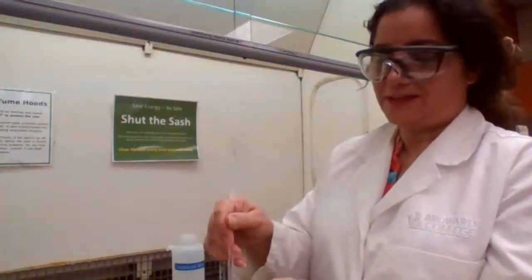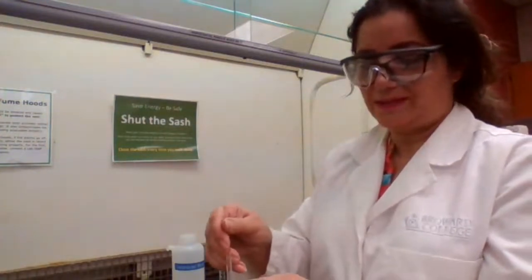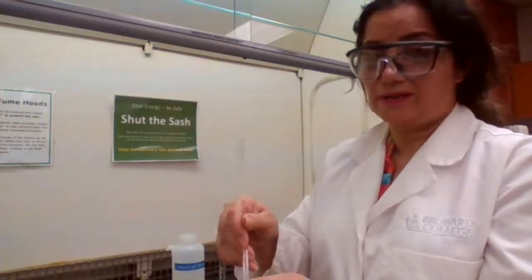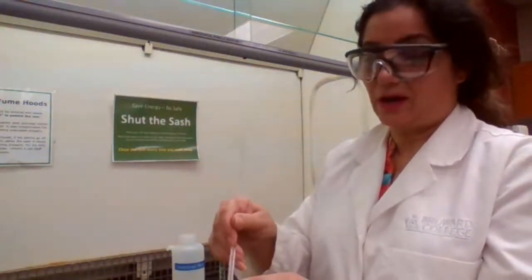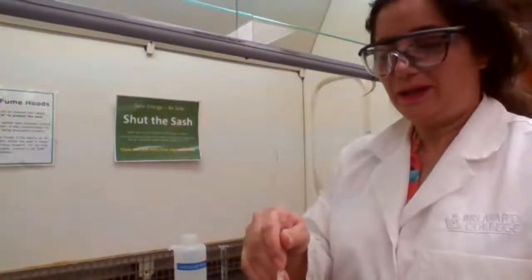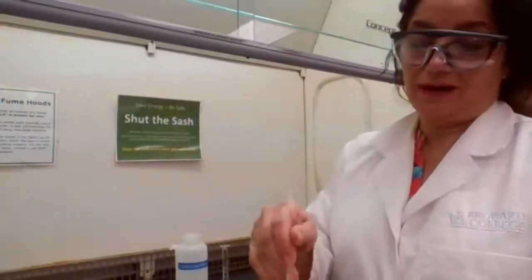And if you take it while it stays yellow and decant it, some unreacted iodine will go into the decanted solution, the clear solution, and the mass that you're going to get is not the mass of zinc iodide. It would be the mass of zinc iodide plus unreacted iodine, which is not going to give you a correct number, and you will be wondering why the numbers don't work. How come you're not getting straightforward numbers like they give you in lecture?